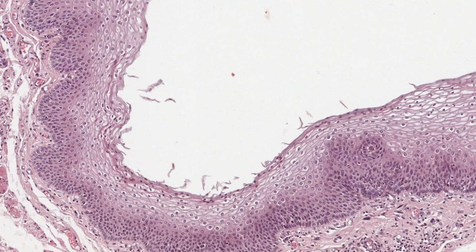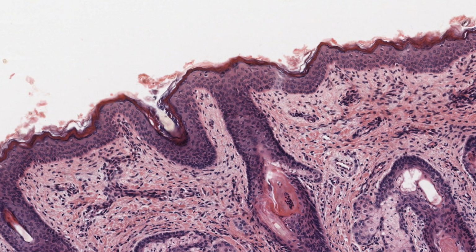In the oral cavity, areas of the tongue, palate, and the gingiva, which receive continual abrasion, become keratinized. In some places, the keratin layer may be very thick. Other places are protected by only a thin layer of keratinized cells. In this image of the skin epidermis, the layer of keratin is easy to see. It stains dark red. This section was stained with hematoxylin and eosin.